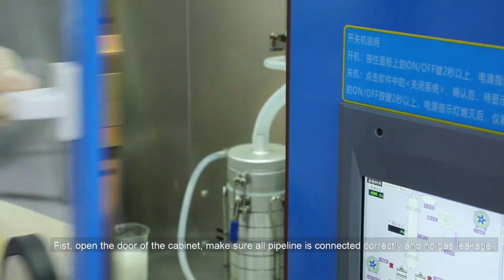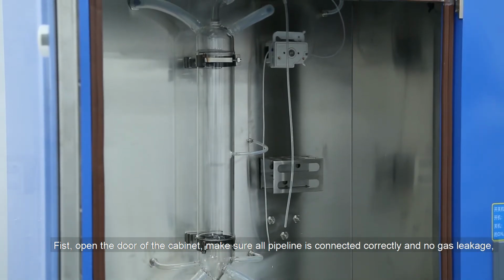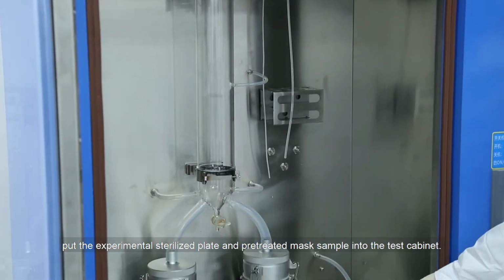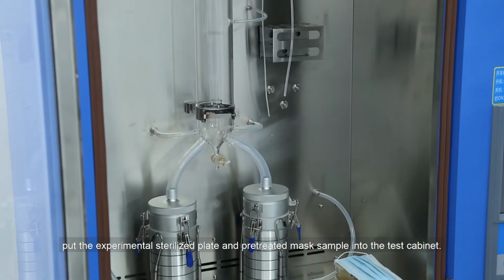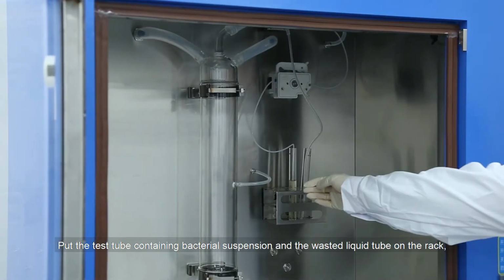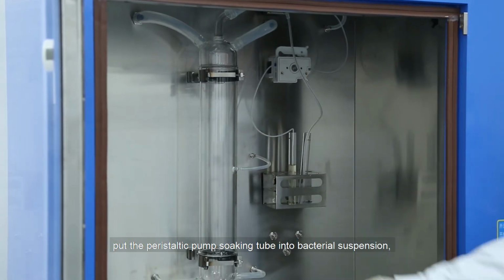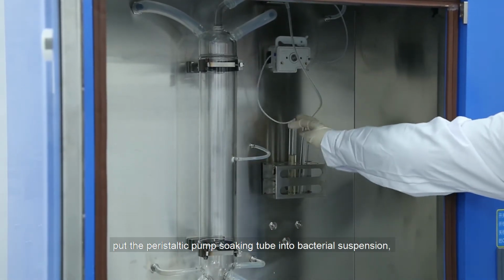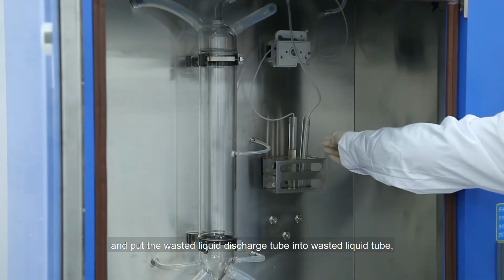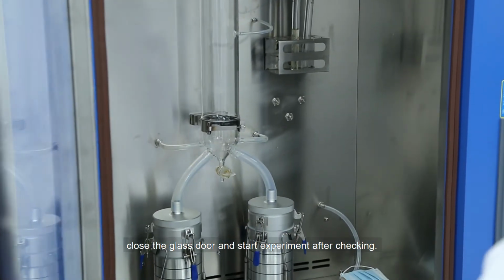First, open the door of the cabinet. Make sure all pipelines are connected correctly and there is no gas leakage. Put the experimental sterilized plate and pre-treated mask sample into the test cabinet. Put the test tube containing bacterial suspension and the waste liquid tube on the rack. Put the peristaltic pump sucking tube into the bacterial suspension, and put the waste liquid discharge tube into the waste liquid tube. Close the glass door and start the experiment after checking.